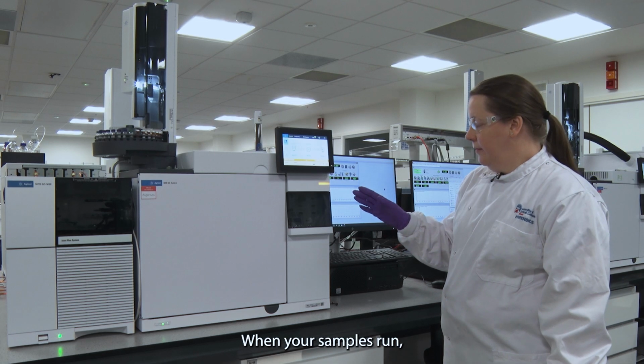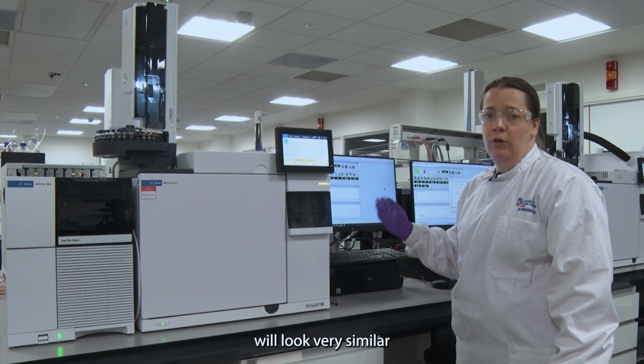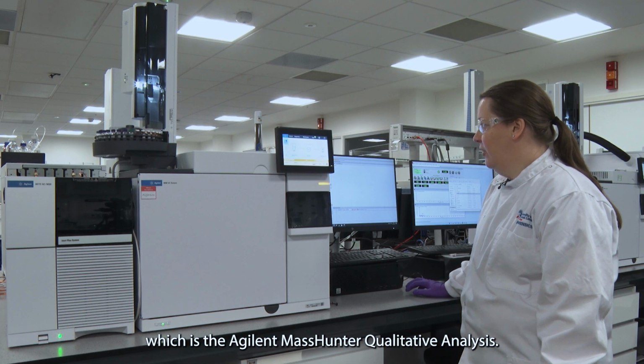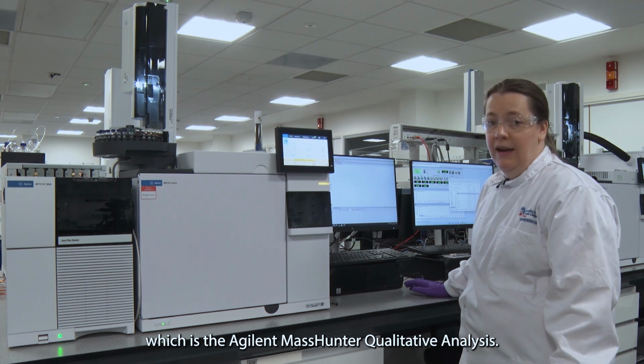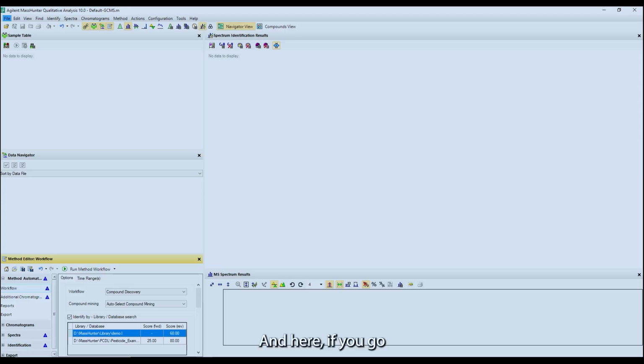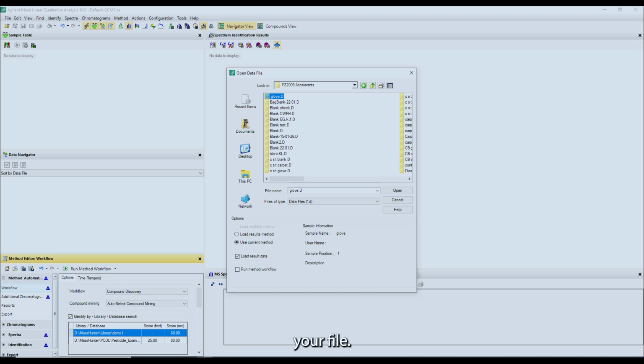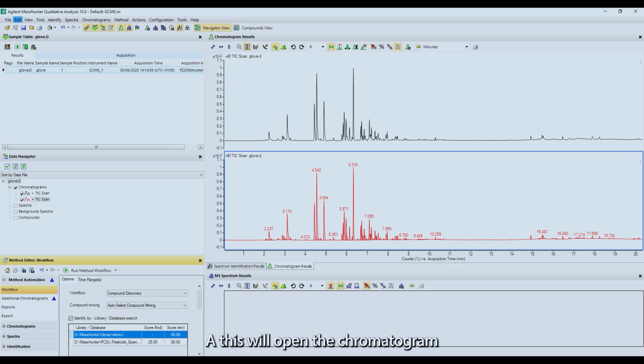When your samples have run, the screen on the computer will look very similar to what you had at the start. You need to go to the other program, which is the Agilent MassHunter Qualitative Analysis, and here you go File, Open Data File, go to the folder for your module, so I'm doing FZ2009 accelerants, and open your file, so mine is glove, and this will open the chromatogram for your results.